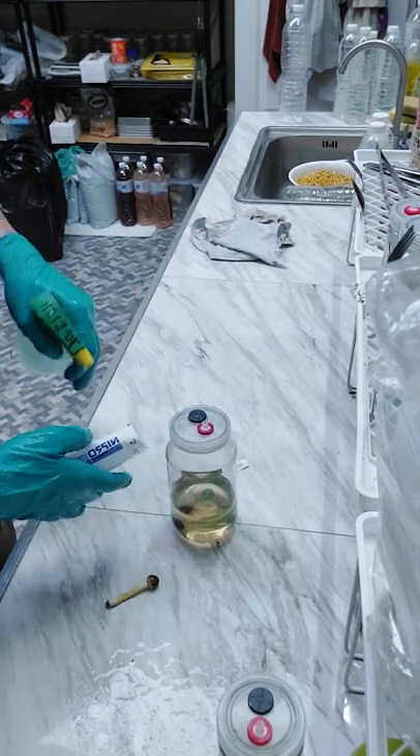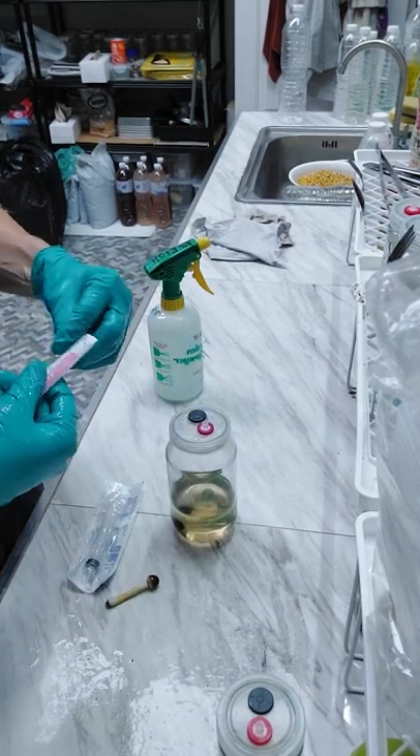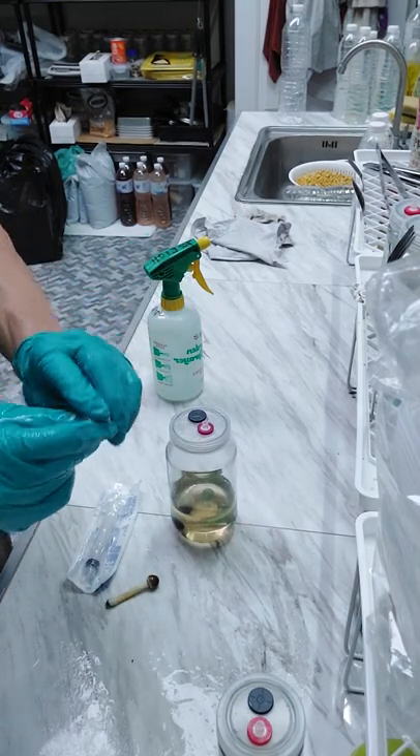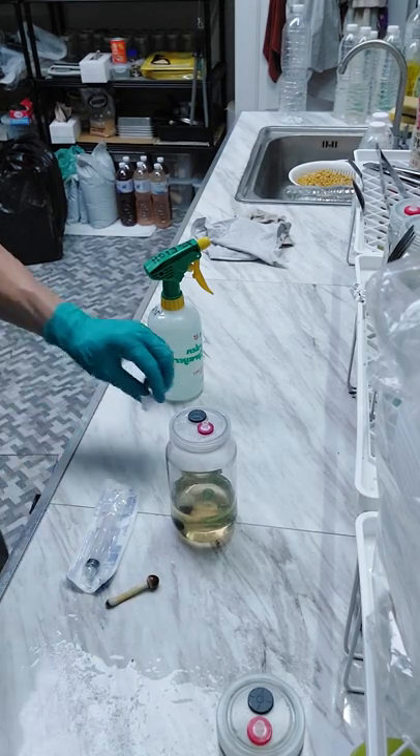So again if you're a little OCD — which I am — maybe do a little bit of this, a little bit of that. And I like to open these syringes up, or not really open them up, just kind of fold them back so that you can work faster.